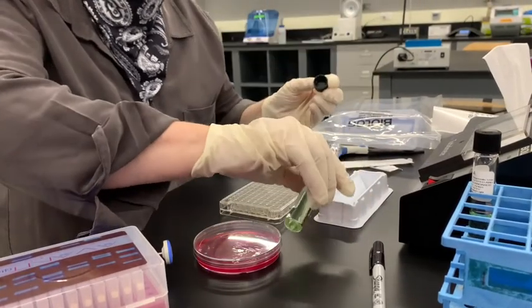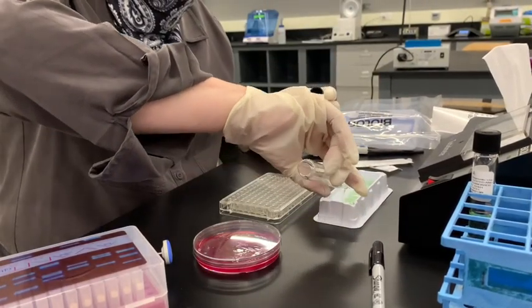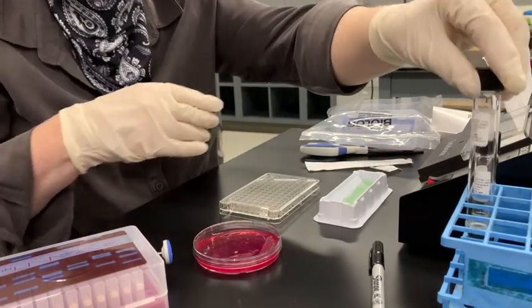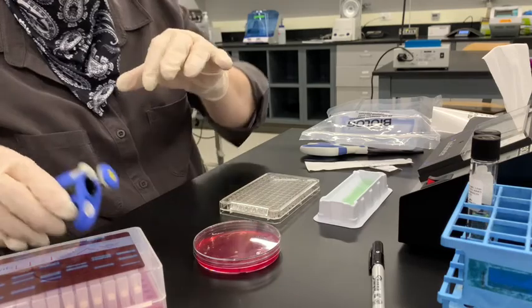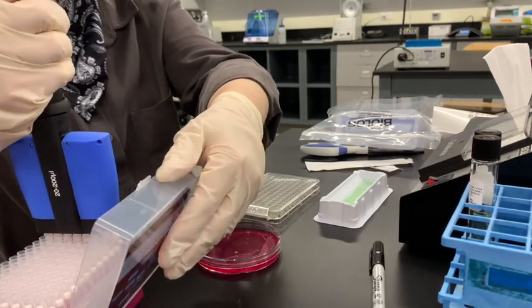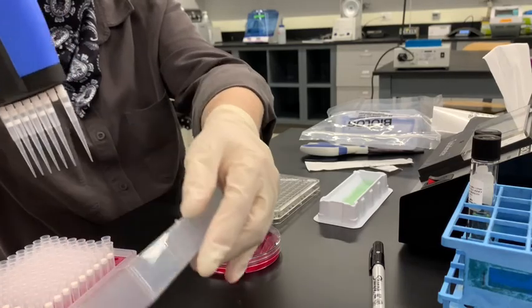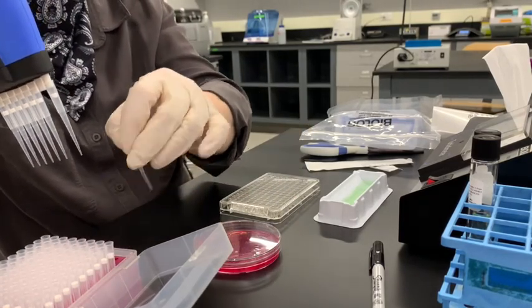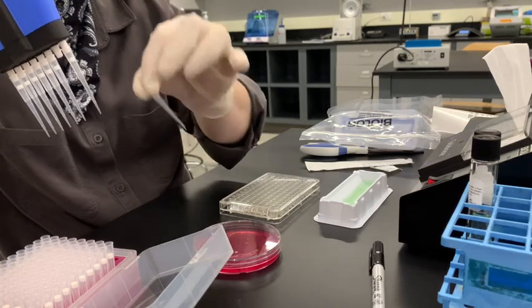And then I'm just gonna pour it in here. And gonna put our tips on. And we gotta make sure, see how that one fell off? Not good. So this is gonna go like this.